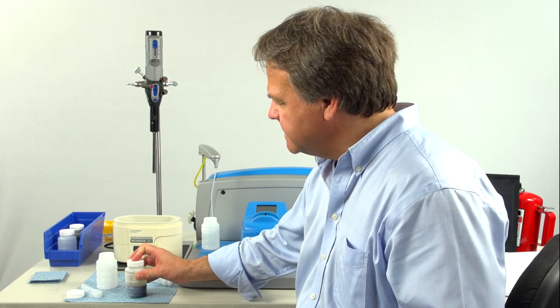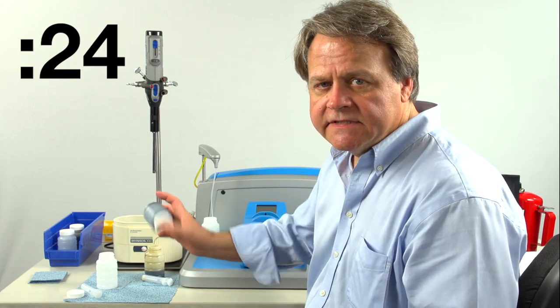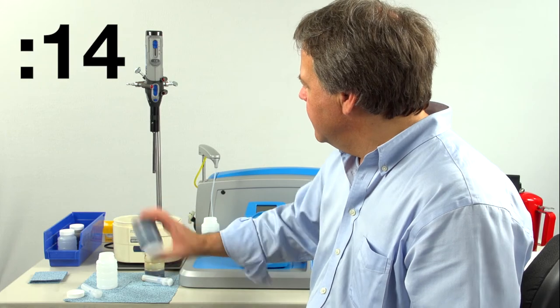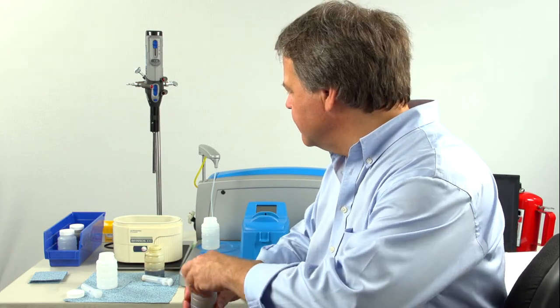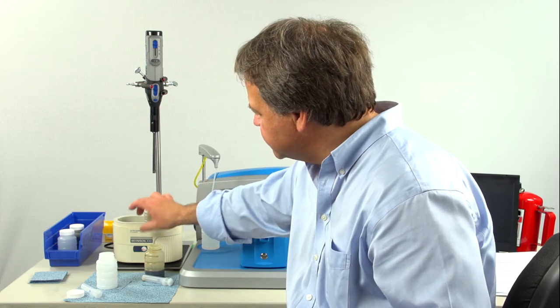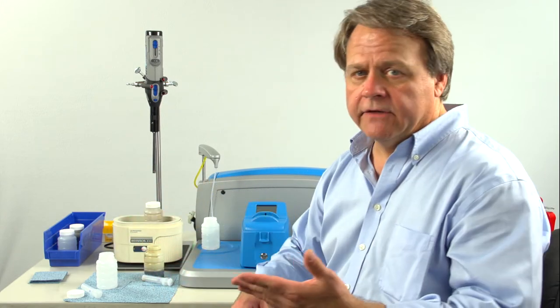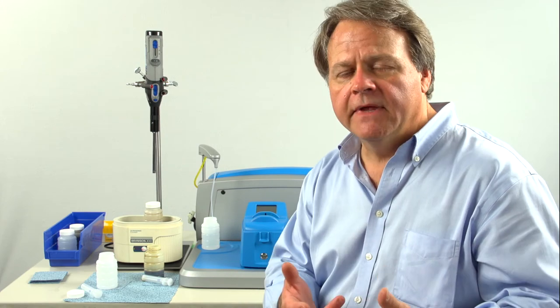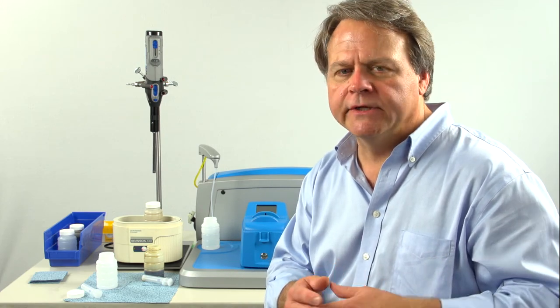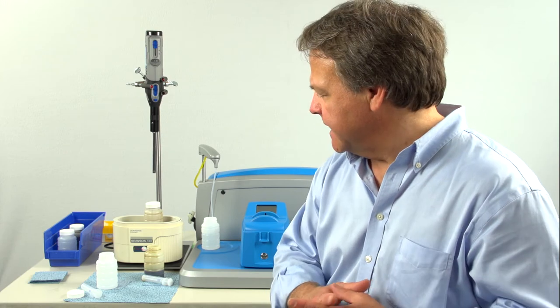And once that's done, again agitate the sample for 30 seconds. Once the 30 seconds has elapsed, place it in the ultrasound, again for 30 seconds and that will remove the air bubbles. So that is one methodology of preparing a diluted sample for analysis in the LNF.